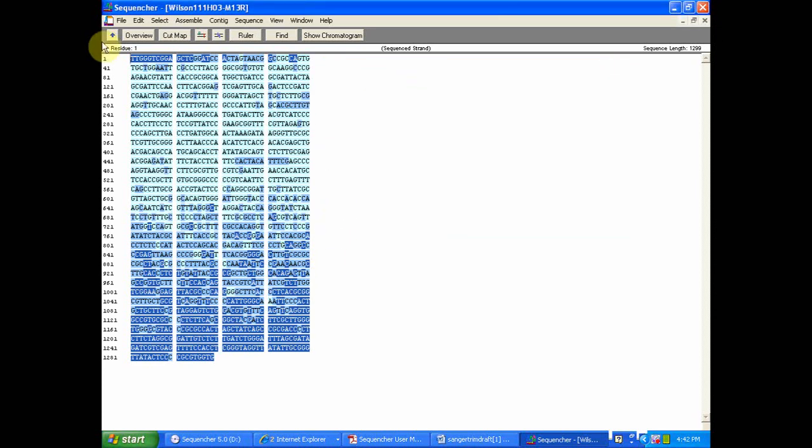The other thing I can tell just by pulling this up is this data is pretty consistent with general Sanger-style sequencing reads. You see that initial string of poor quality bases, followed by this nice region of high quality data. I'm going to go ahead and close out of that.